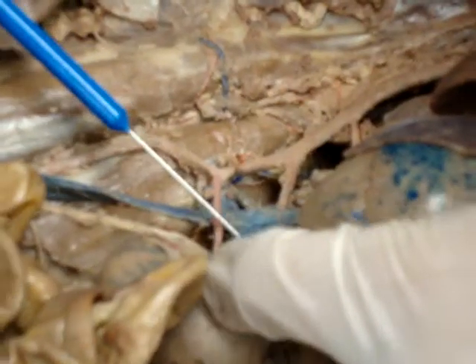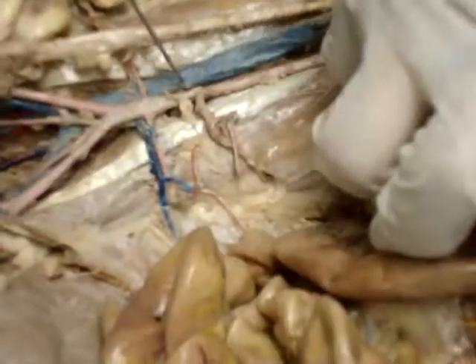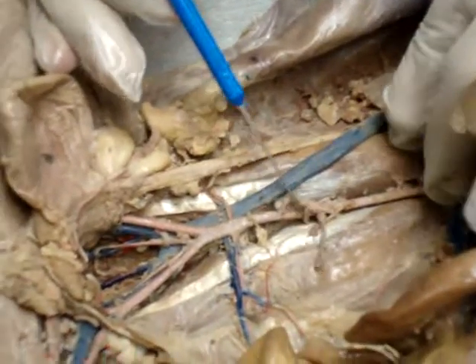Right here would be the renal vein. Going down on the artery, this would be the inferior mesenteric artery.